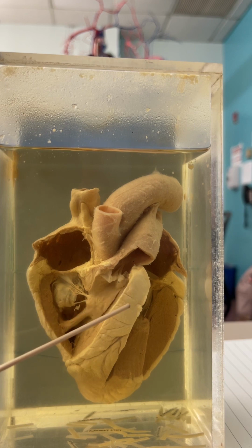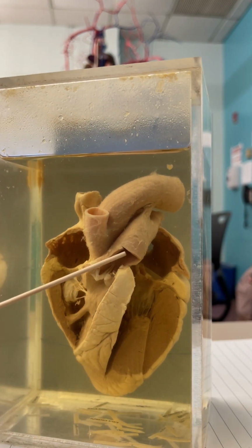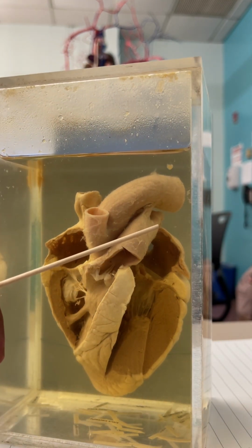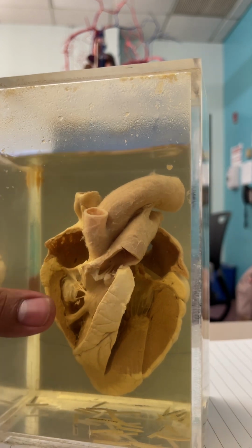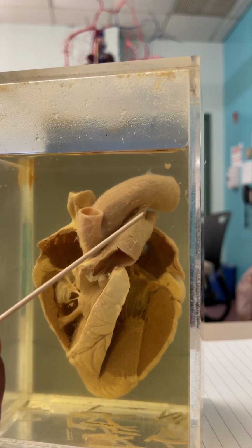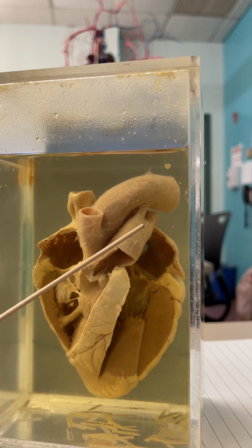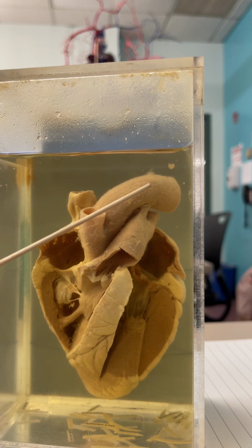Right ventricle leads up this way. Here is the interventricular septum. This is a large piece of muscle. Right ventricle leads up through the pulmonary trunk, right here. Pulmonary trunk comes up and splits into the right, well, this is the left pulmonary artery, but that you can't really see. This little piece, when you shake it, holds those two together, that's the ligamentum arteriosum right there. Everyone sees that? The little structure right here that holds the aorta and the pulmonary trunk together.